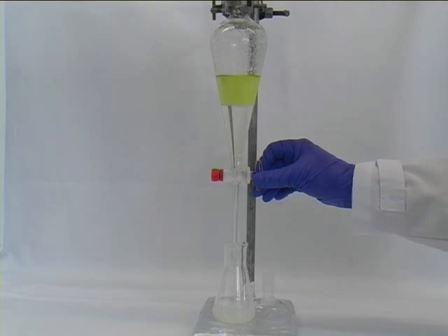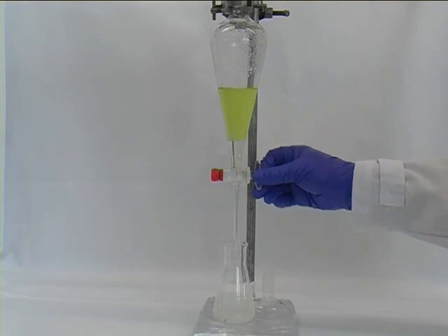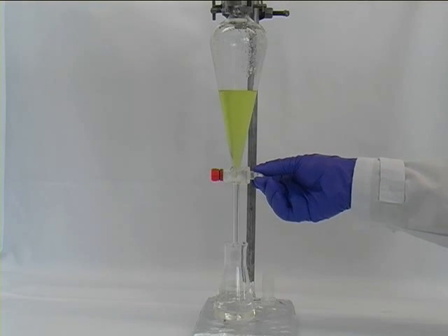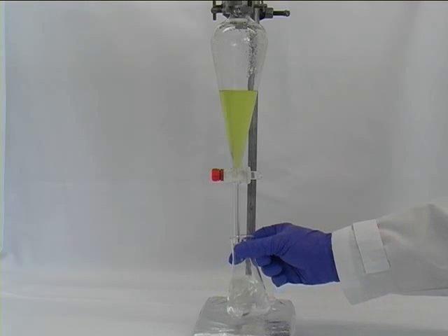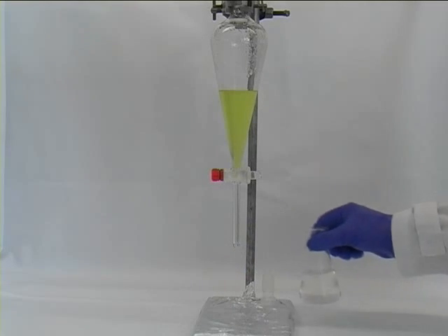Please be aware that it might not be in any case an aqueous phase and an organic phase. It could also be two immiscible organic phases. In any way you have two phases of which you want to keep one now and the other one you want to discard.